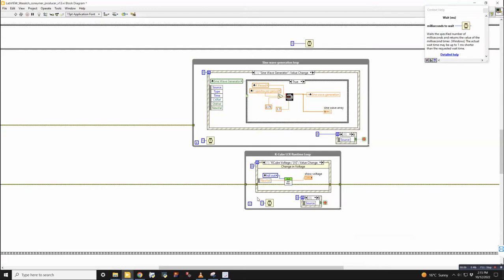How did you decide on 1 millisecond? So you've got to figure out what your rate determining step is. In this case, nothing is going to run slower than the acquisition time for a spectrum. As in, the spectrometer is the rate limiting step. Okay. So 10 milliseconds is about the fastest that you're ever going to acquire a spectrum. I think the user manual says 40 milliseconds is the minimum amount of time that you should be collecting light for a spectrum.